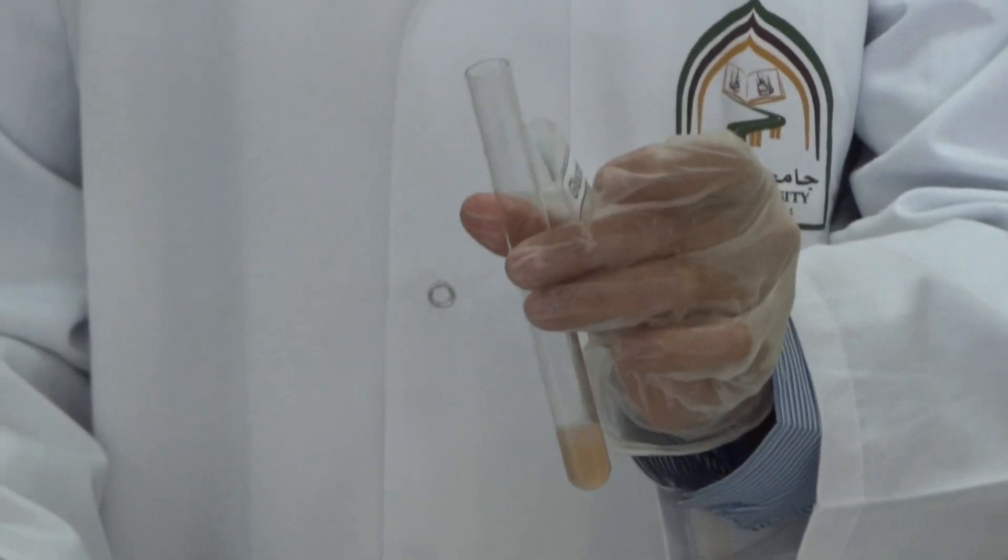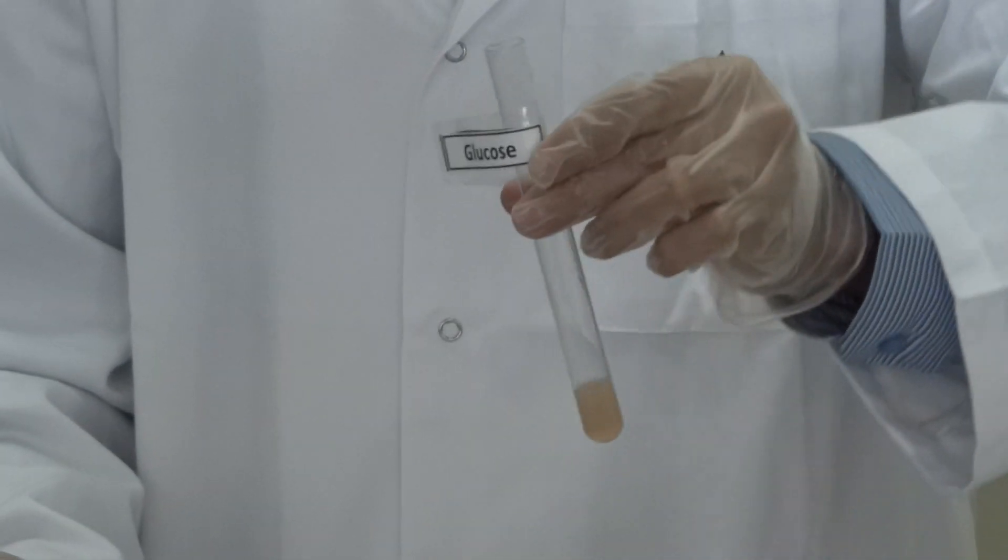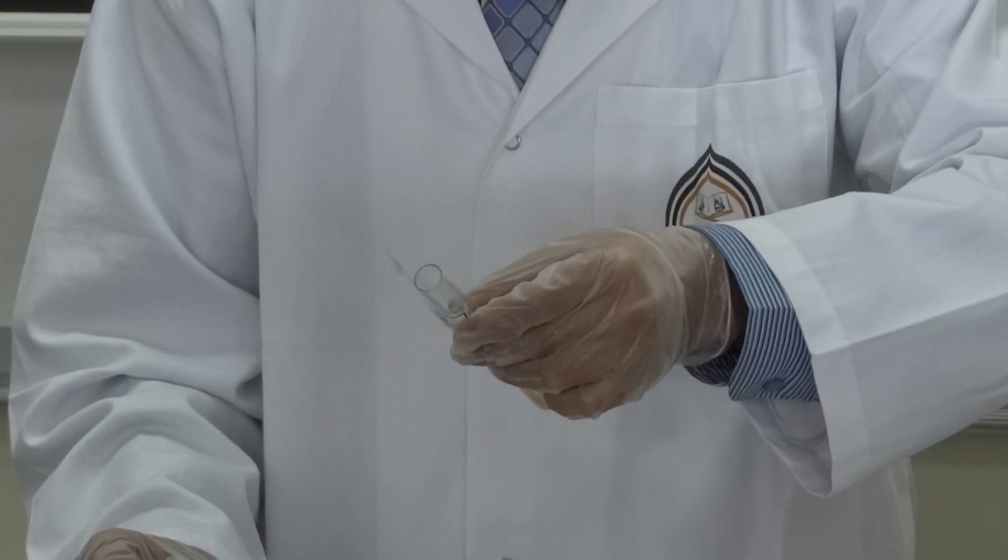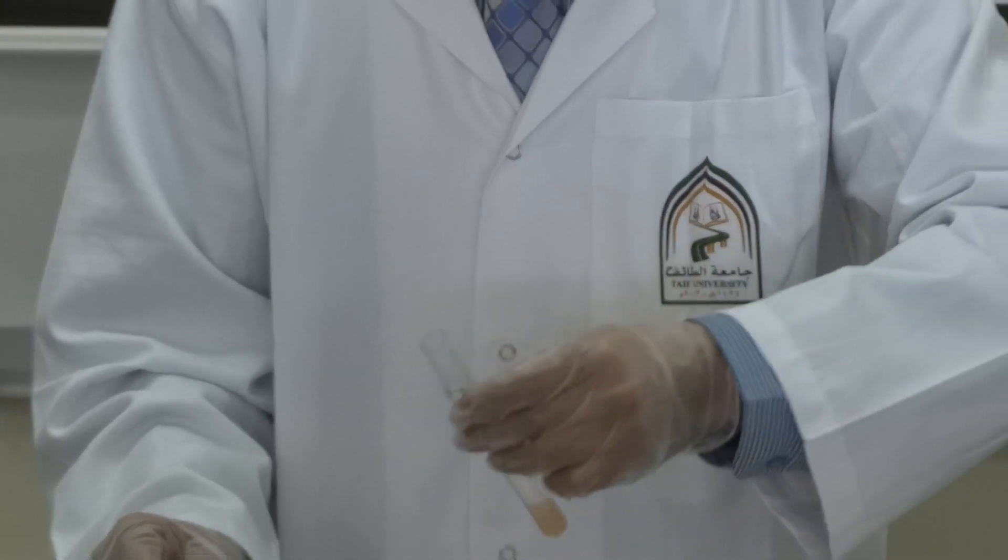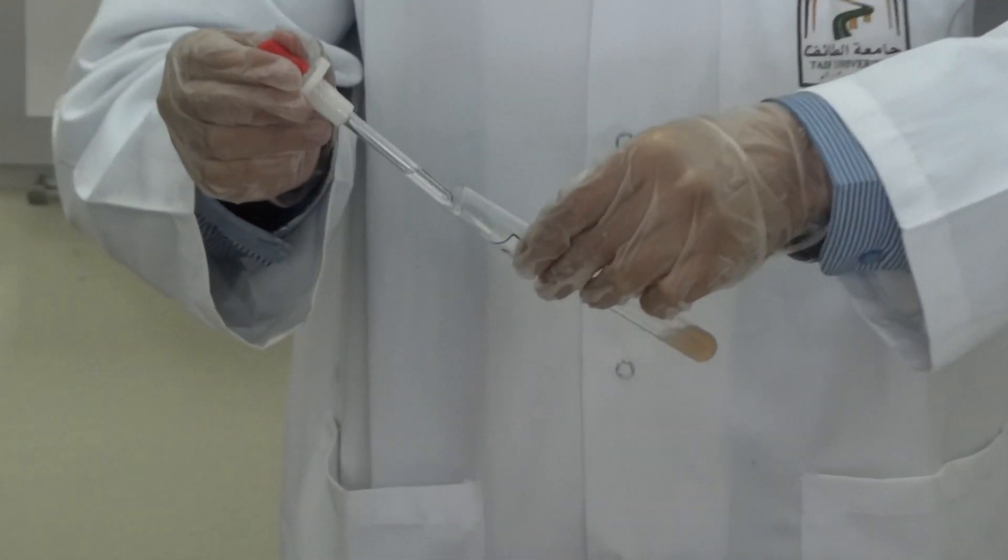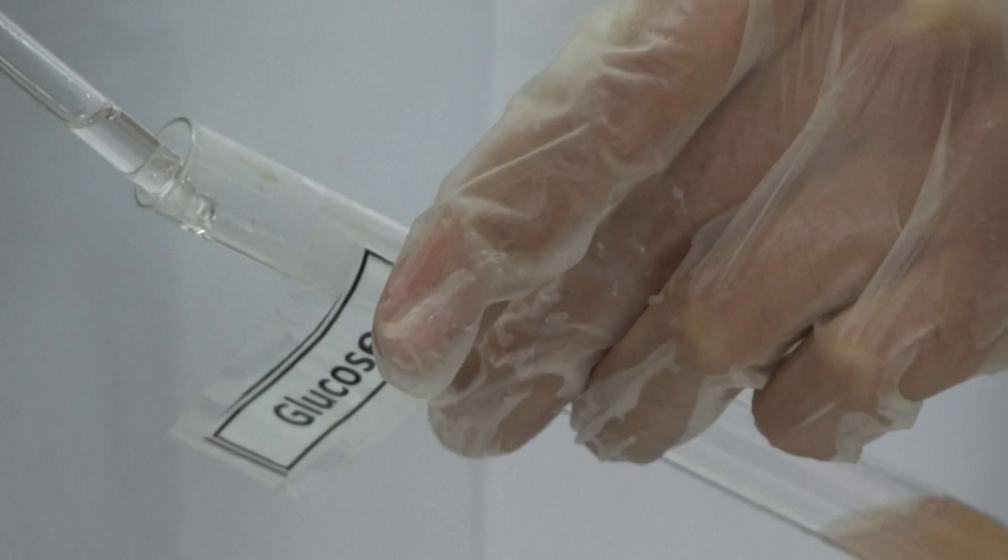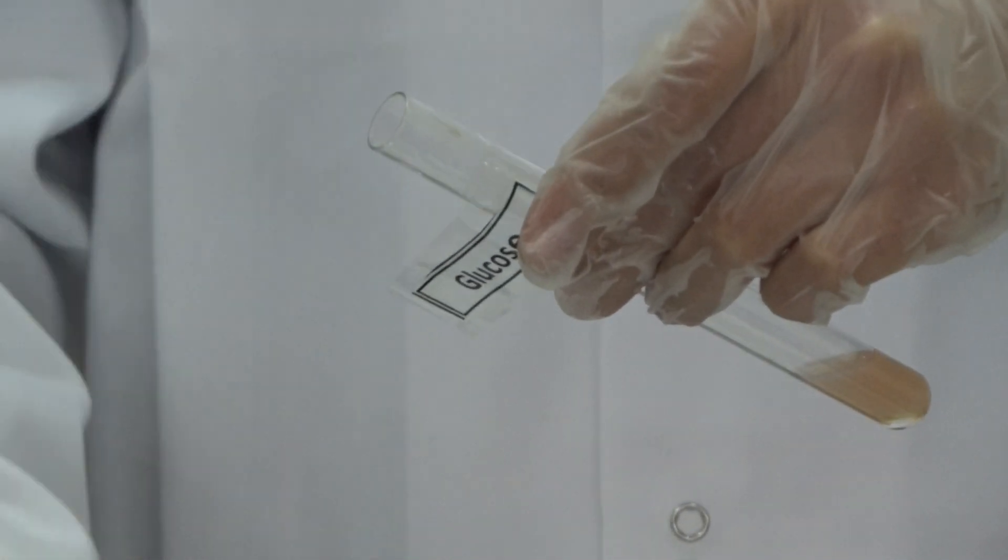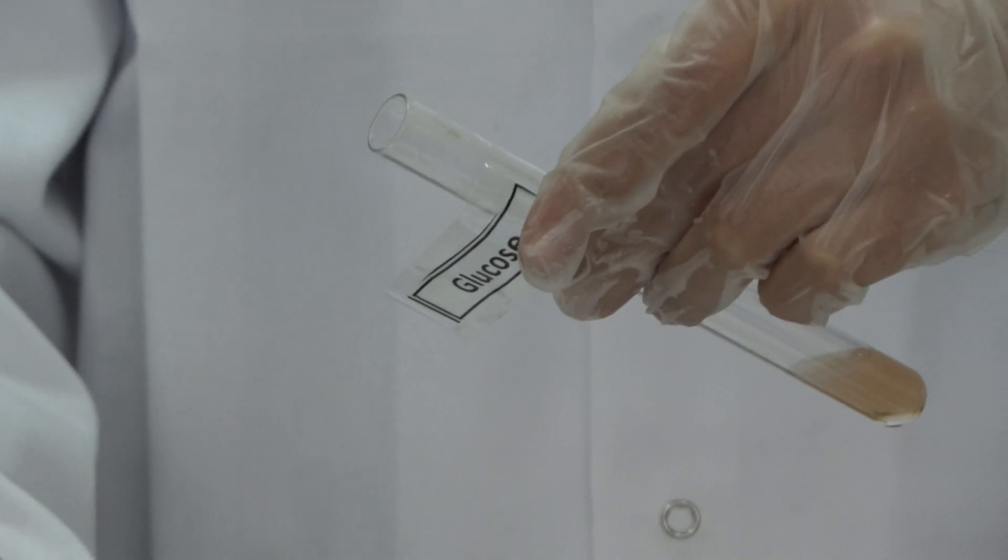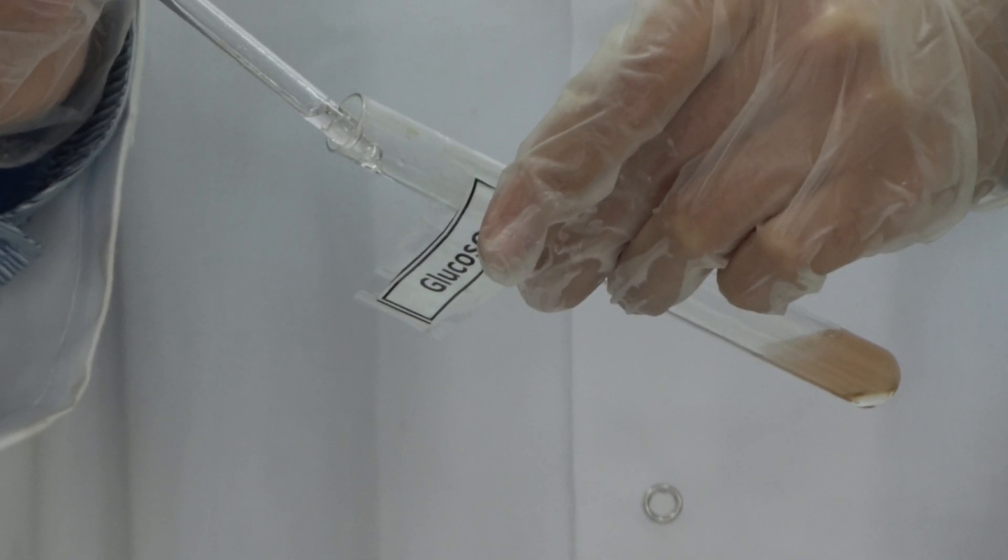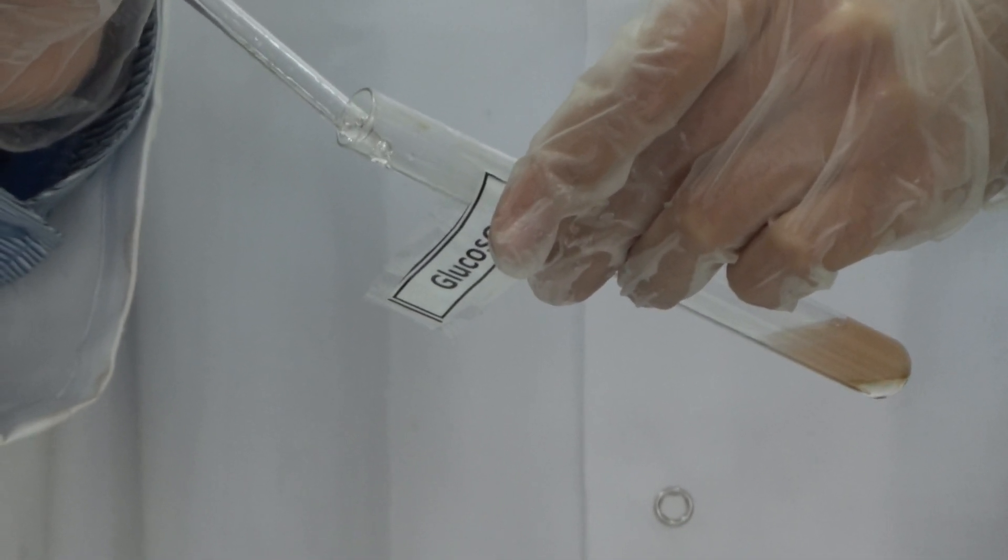Start first with the carbohydrate. As I said, bend the tube, not facing yourself, not facing any of your colleagues, just in case something can get out of it, doesn't harm you or harm your colleague. At the side of the tube, slowly, slowly, add sulfuric acid. Very, very slowly. Need to add about 2-3 ml.